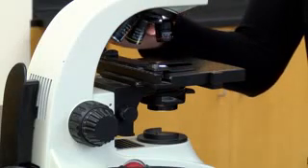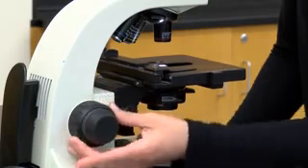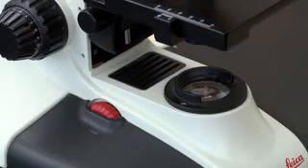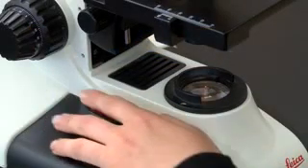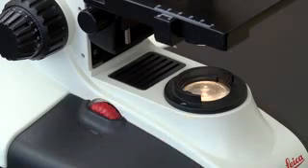Put the objective lens on low power and move the stage to its highest position. Adjust the light to the medium or medium-high range. You can adjust the light later to improve the image. The brightest light doesn't necessarily result in the best image. Now you should be ready to start using the microscope.